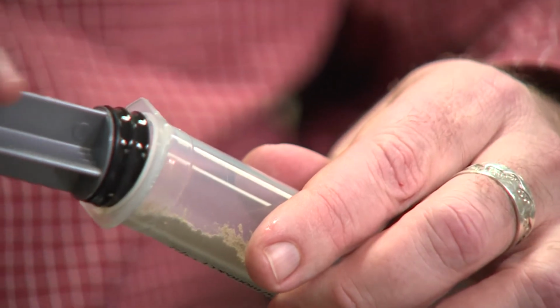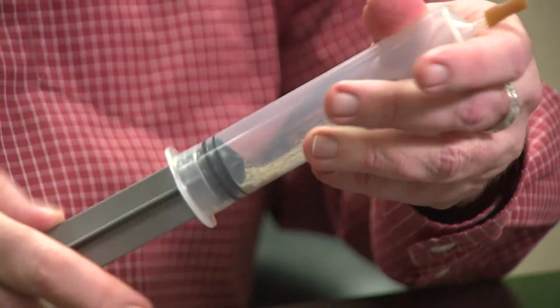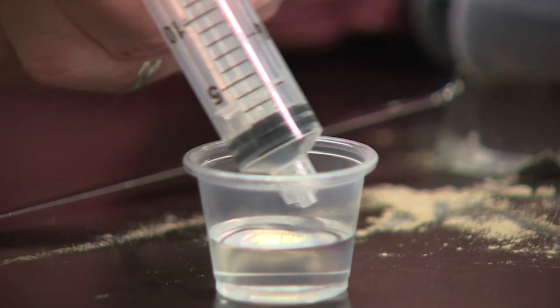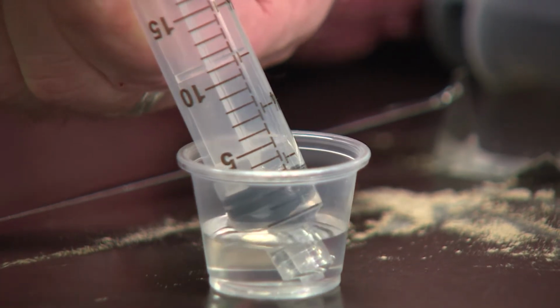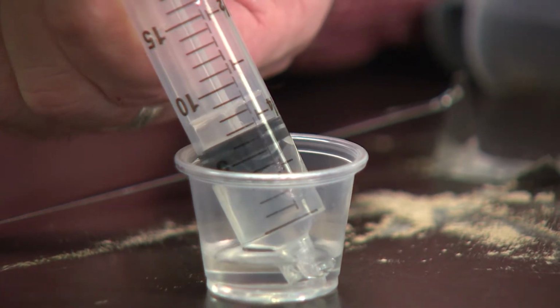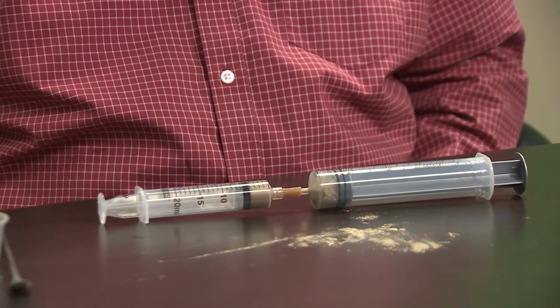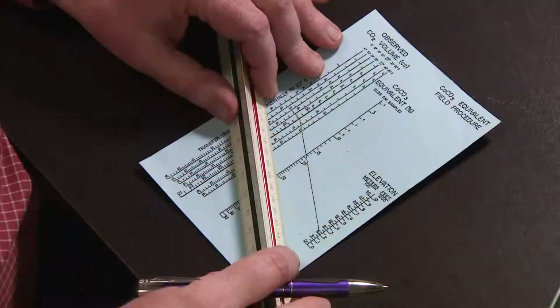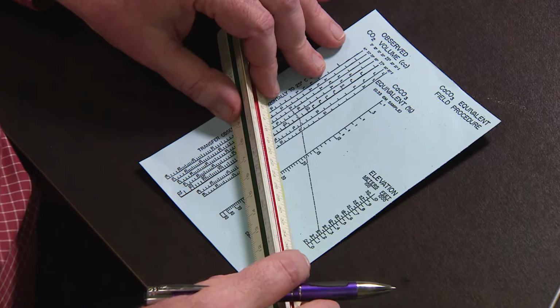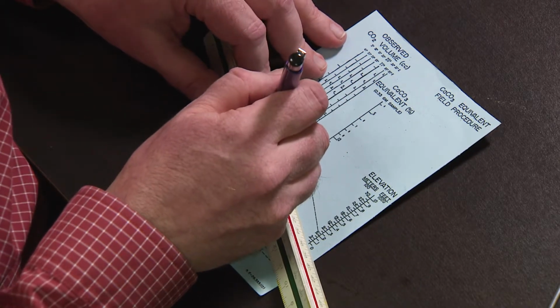Sometimes it is necessary to measure the calcium carbonate equivalent contained in a soil that effervesces for purposes of soil classification. Carbonate content of a soil is used to define carbonatic, particle size, and calcareous soil classes, and to define calcic and petrocalcic horizons. A field procedure was developed to measure calcium carbonate by using a simple volume calcimeter from a 50 milliliter and a 20 milliliter plastic syringe.